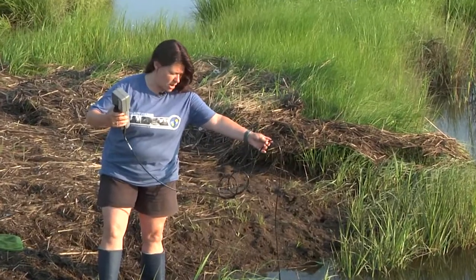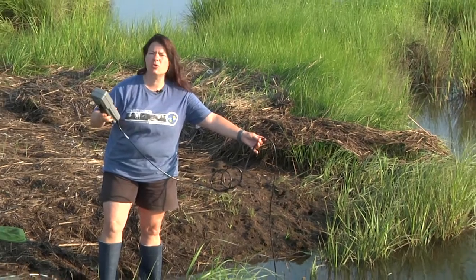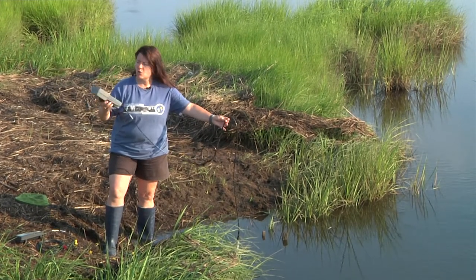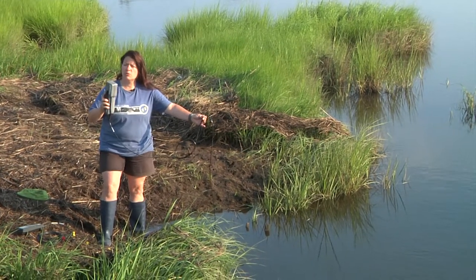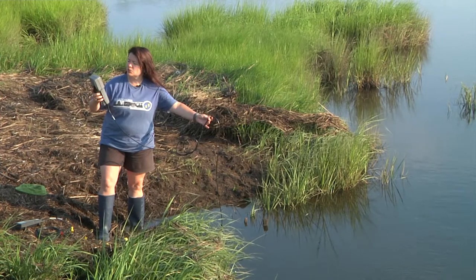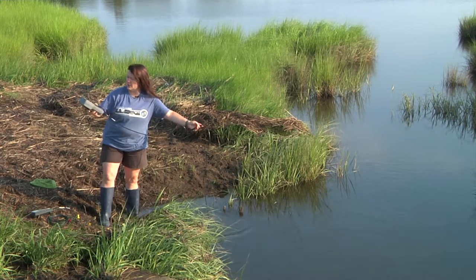When you're looking here in the water column, you're going to see that it gets fresher towards the surface. In this case, it's also not as basic as it was at the front of the marsh. We have about 6.5 pH, where we had closer to 7.3 pH at the very front of the marsh near where the ocean is. Our salinity at the very surface is right at zero, but if I lower the meter through the water column, we get a salinity of about 8.9.